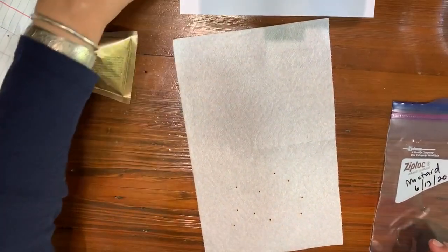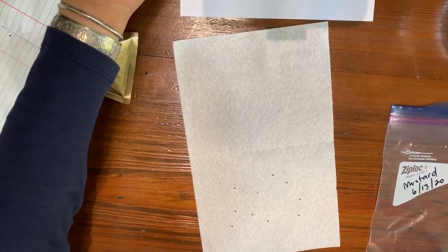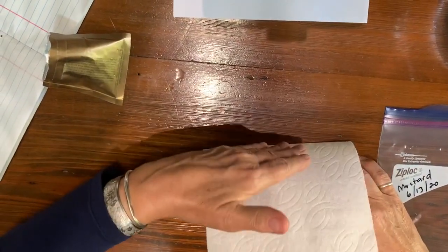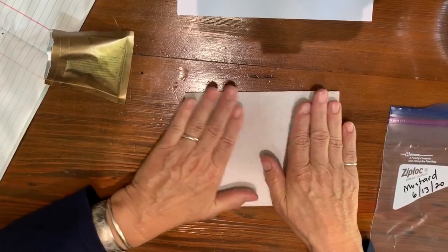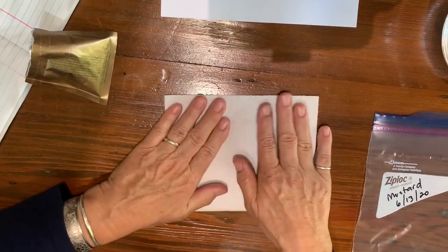So I've arranged them. Number four says arrange them so they aren't touching each other, and then fold the other half of the towel over the arranged seeds. Try not to jiggle it too much. You can lay them in rows — whatever is easier for you.